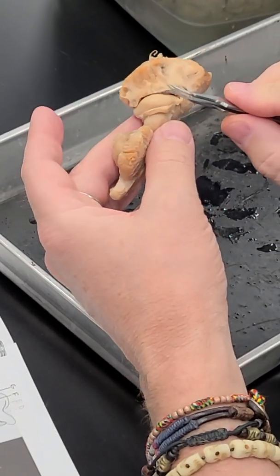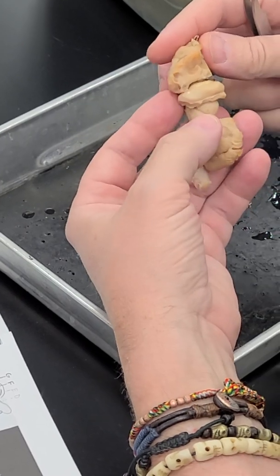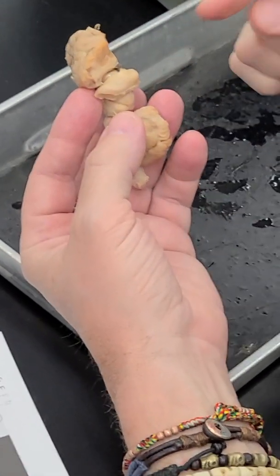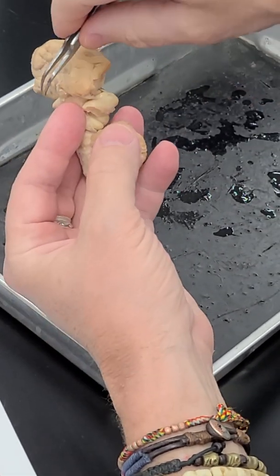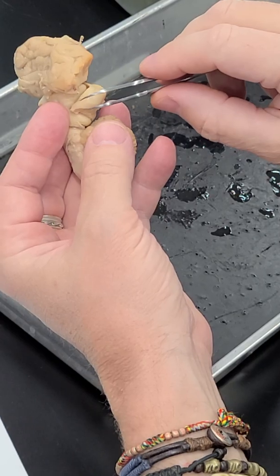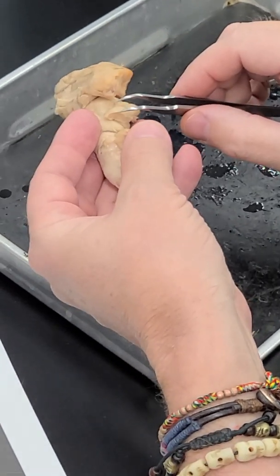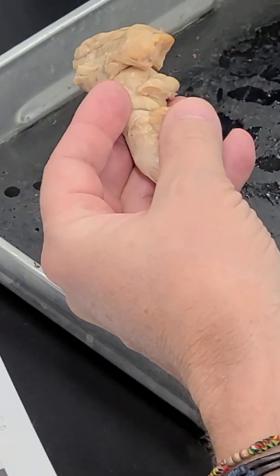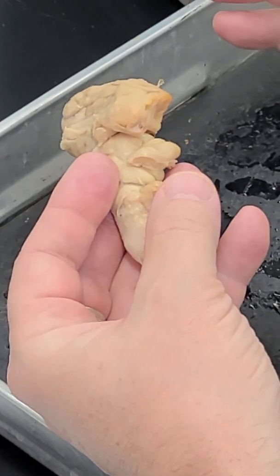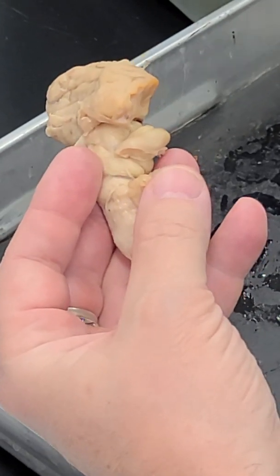So anyways, on the surface, we have these layers of fibers. And if we pull up the hippocampus carefully, it forms this C shape that goes down into the temporal lobe, and at the end of it is the amygdala. And so this swelling right here is probably the amygdaloid body right here. And it's very similar to the hippocampus and is linked to it in a number of different functions or pathways, circuits.